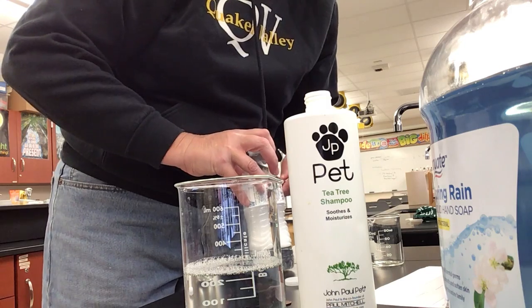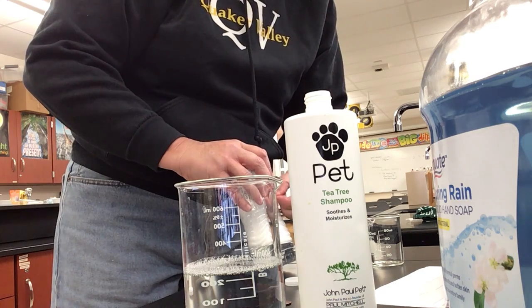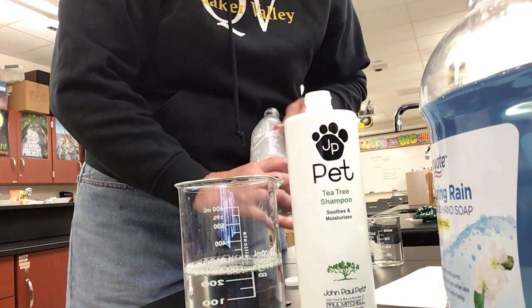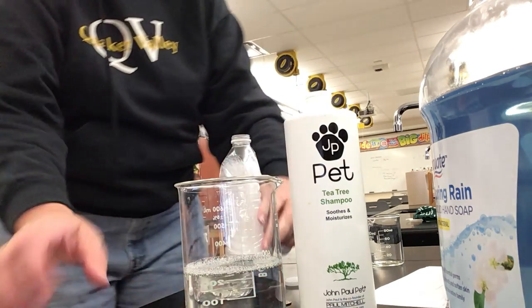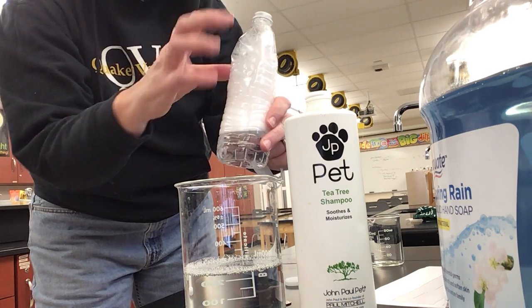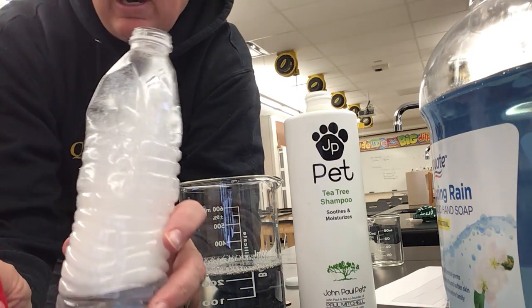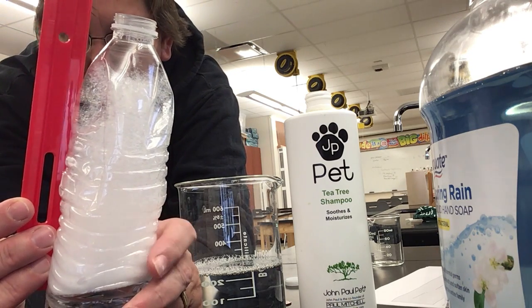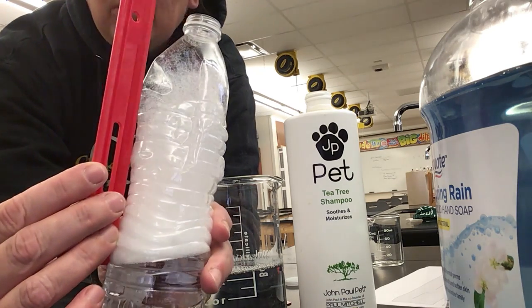At least push it down. Now, this is up to you, but you need to be consistent. The controlled variable that we talked about, you'll notice that it's much more bubbly at the top than it was before. As I squeeze this, I'm pushing this up. So I'm definitely going to measure from the bottom where it's thick and ignore this bubbly stuff, or real airy stuff. That's up to you, but you need to be consistent in how you do it so that it's a controlled variable, okay? So if I measure just the thick stuff that existed before, I'm down at 6 centimeters.